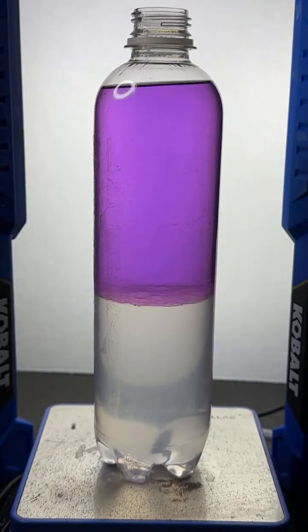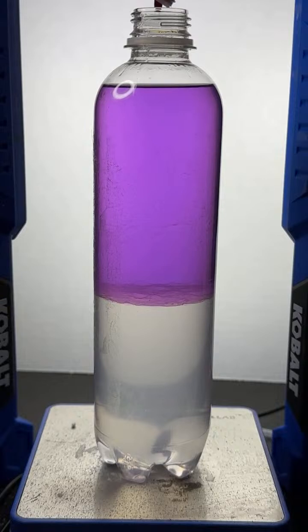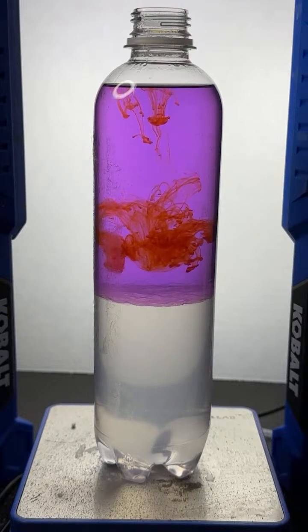We'll do 2 drops, all right? Thank you there, Frequency and Vibes. Here we go. 2 drops. There they go, of the pink.